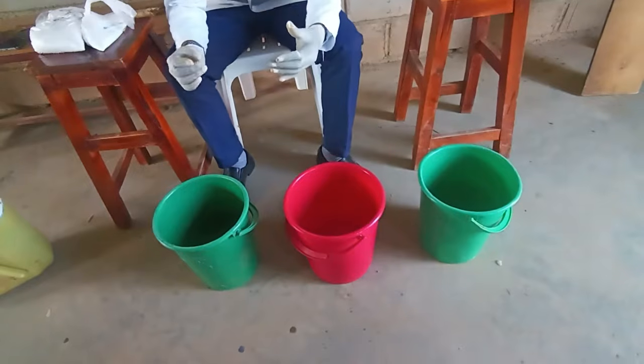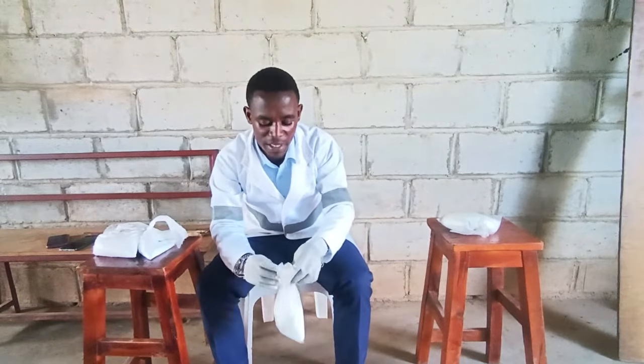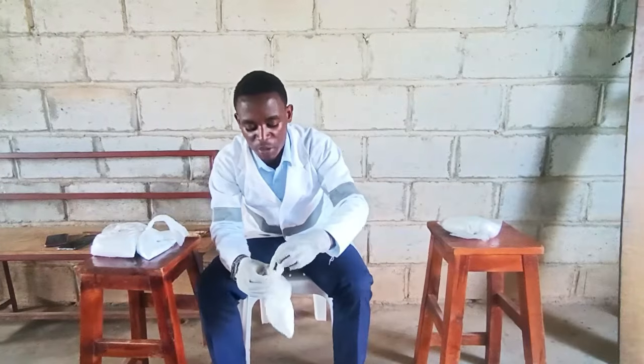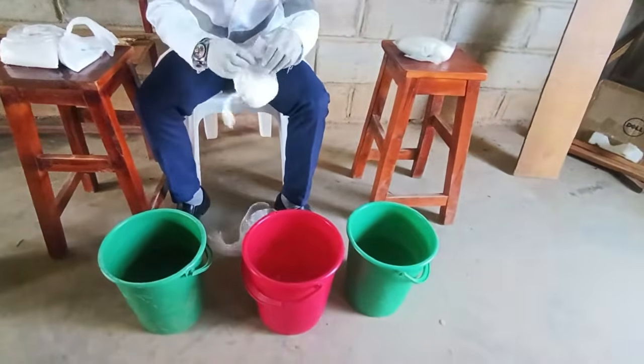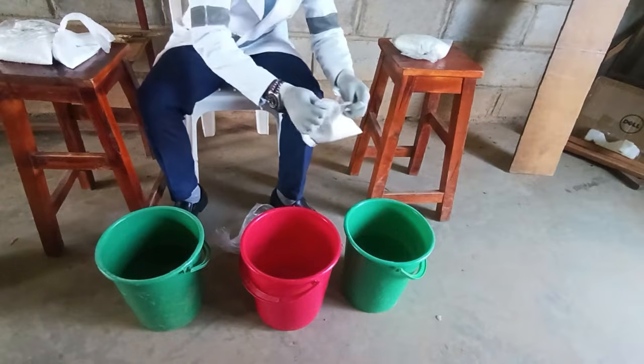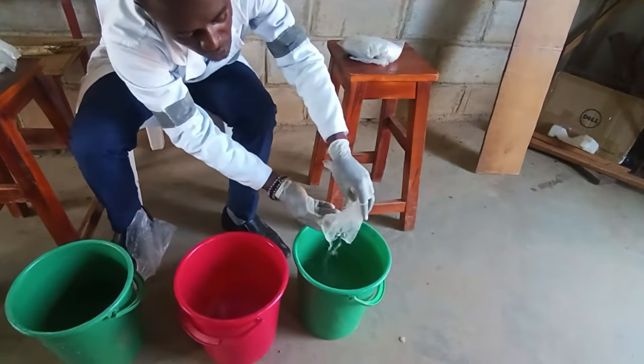Since we are dealing with chemicals, we need to put on safety gear. You can see I've put on gloves, but I also have a lab coat. All these are to help in prevention of different risks that may come along when you're making this. Because we're dealing with chemicals, we know very well that this caustic soda is corrosive, and therefore when it pours on your body, it can easily cause some burns. That's why we need to make sure that you have gloves. So in one bucket, these are 5 liters. We are going to dissolve the caustic soda in the first bucket. Okay, let me have one person come and dissolve this.